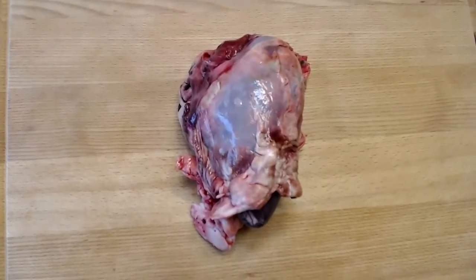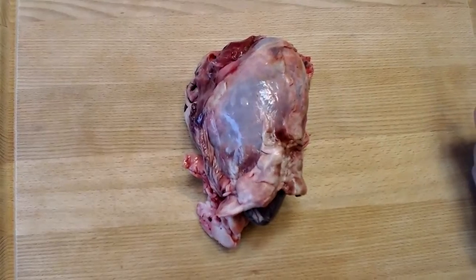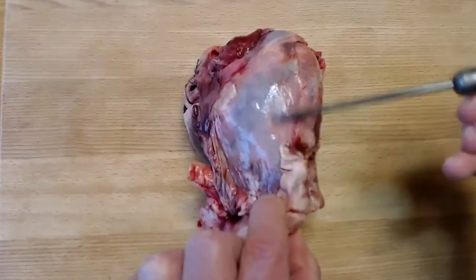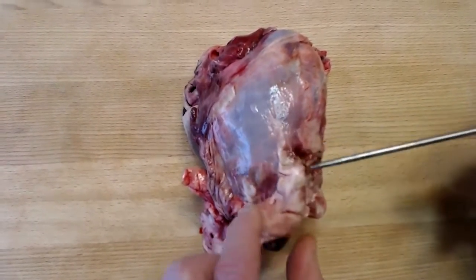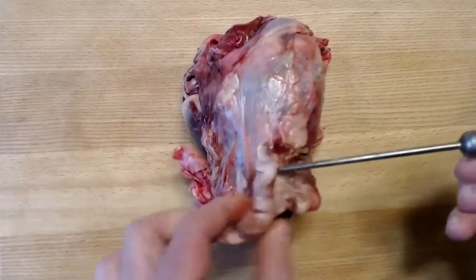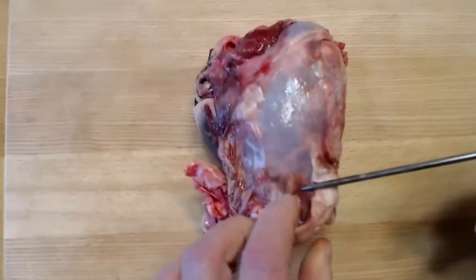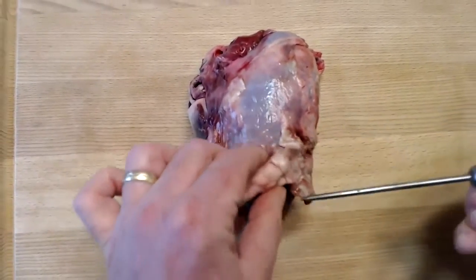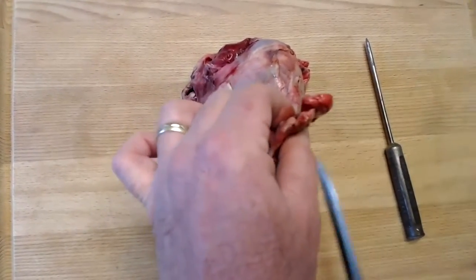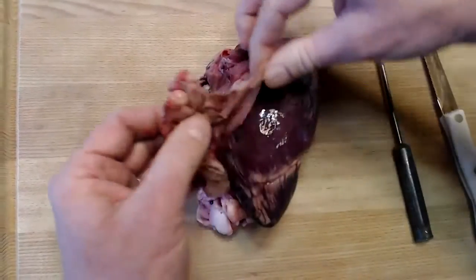And just to point out a couple of features here, one thing that we just mentioned a few moments ago is the fibrous pericardium, which is on the surface here of the heart. That's this rather thick membrane that you can see right here. Note again the amount of adipose tissue or fat here on the very surface of the fibrous pericardium. That is pretty typical, not only of deer, but of people too. So I'm going to open this up a little bit and cut the fibrous pericardium so we can see the actual heart underneath. So I'm going to fold this back.